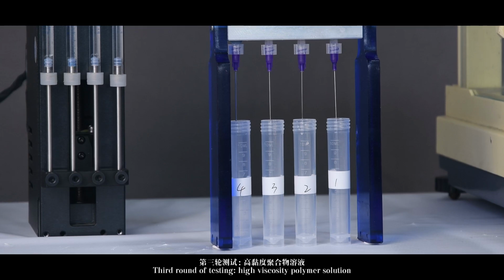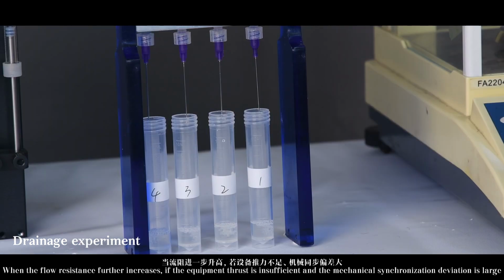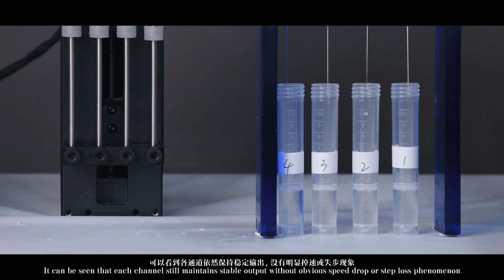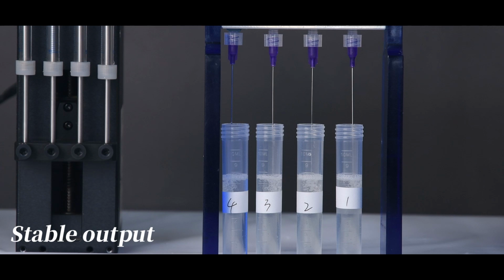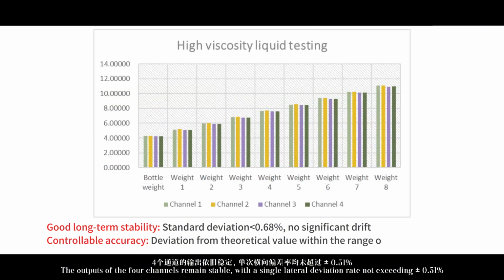Experiment 3. Third round of testing, high-viscosity polymer solution. When the flow resistance further increases, if the equipment thrust is insufficient and the mechanical synchronization deviation is large, it is easy to experience a decrease in flow velocity or output lag in some channels. It can be seen that each channel still maintains stable output without obvious speed drop or step loss phenomenon. The outputs of the 4 channels remain stable, with a single lateral deviation rate not exceeding 0.51%. Good long-term stability, controllable accuracy.